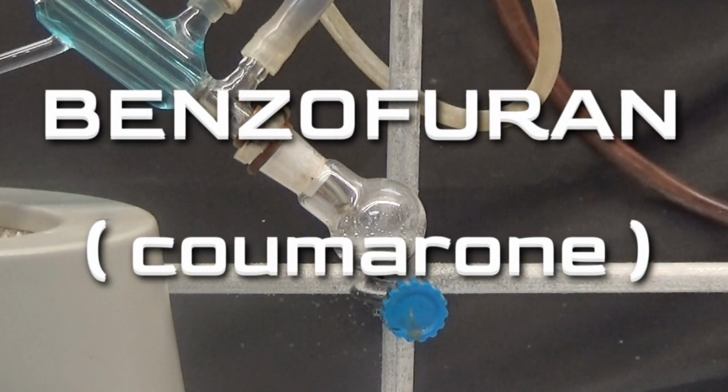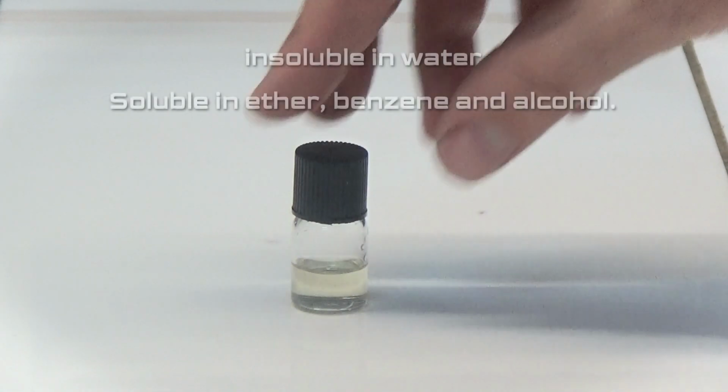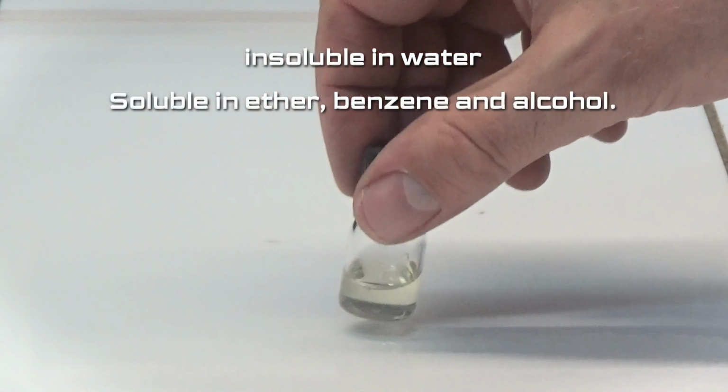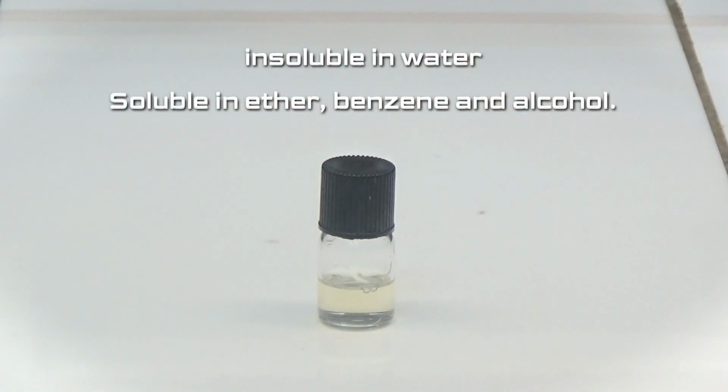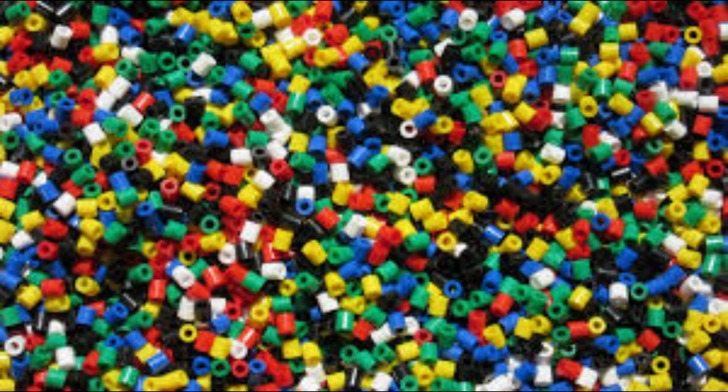In this video, we are going to obtain benzofuran. Benzofuran is a colorless, sweet-smelling liquid insoluble in water and soluble in ether, benzene and alcohol. Benzofuran is used for the manufacture of plastics by polymerization of coumarone compounds.